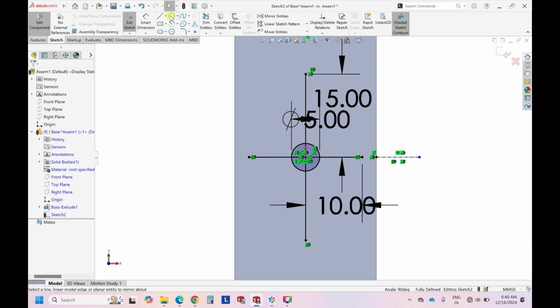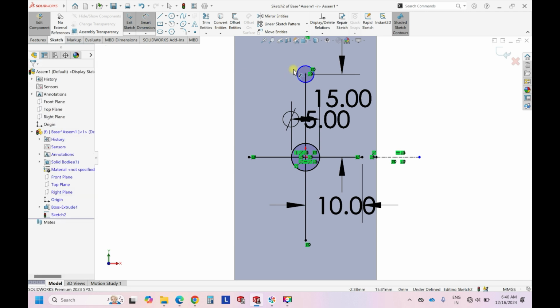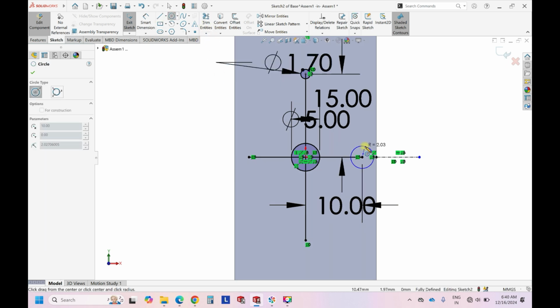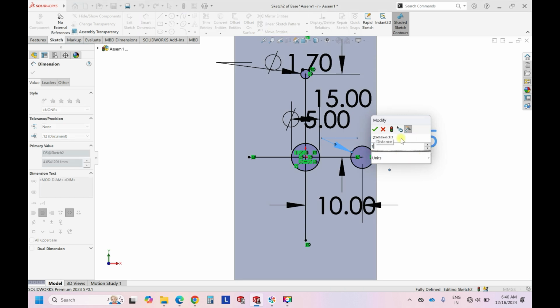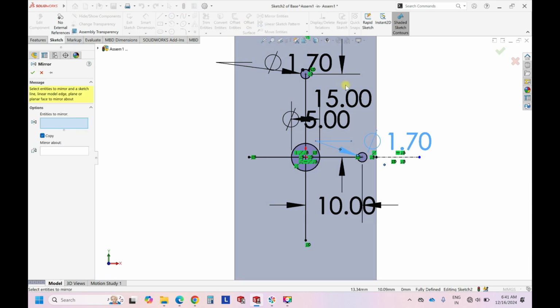Before going to that, we can create the inlets. So for example, like a standard 3D printing, we can go for 1.75 or 1.70 mm. So I prefer 1.70 mm is sufficient. And similarly we can do the same over here. So again, let's use the mirror.